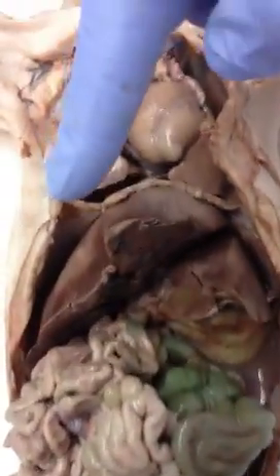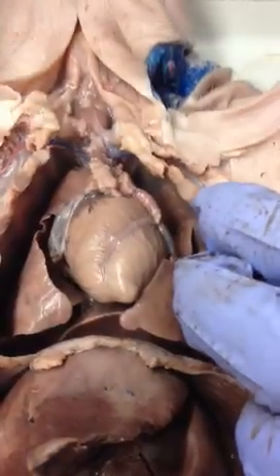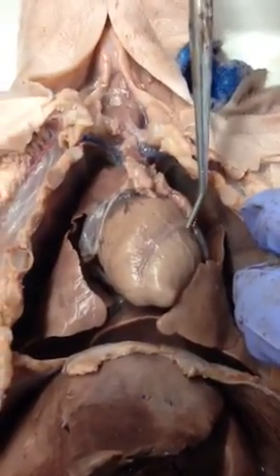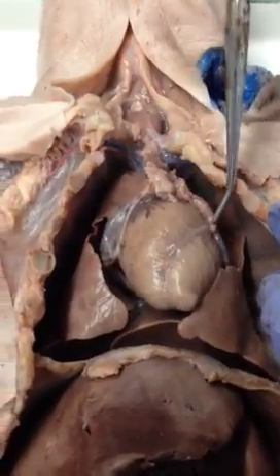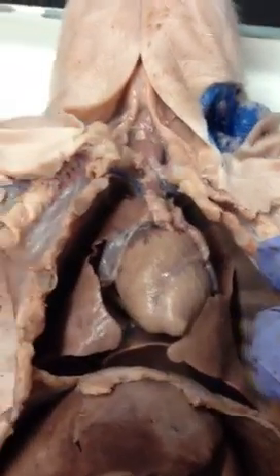The spelling is C-A-E-C-U-M. This is the left coronary artery and great cardiac vein — they're not really distinguishable, but it's this line right here; it's both of them. That's all we learned today.